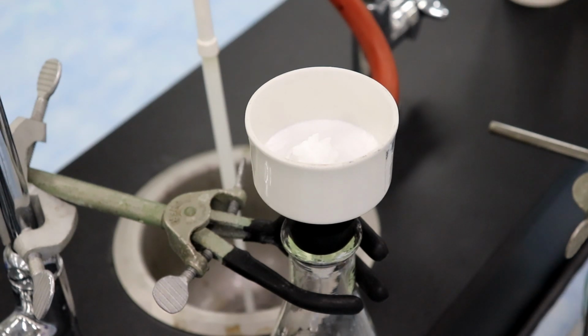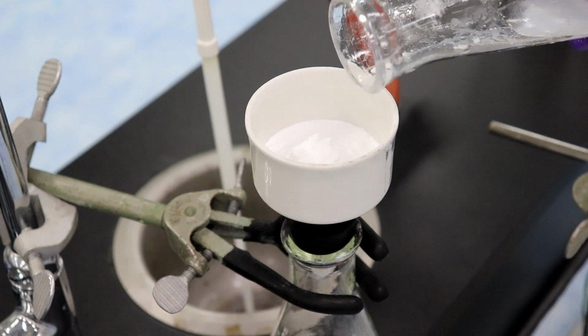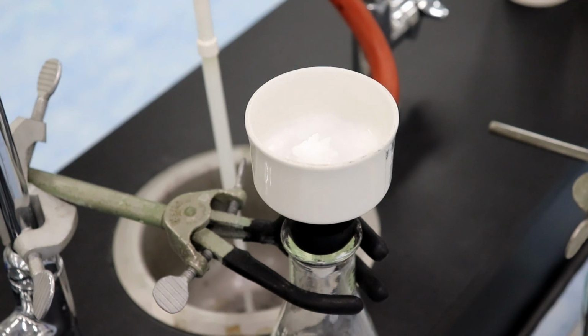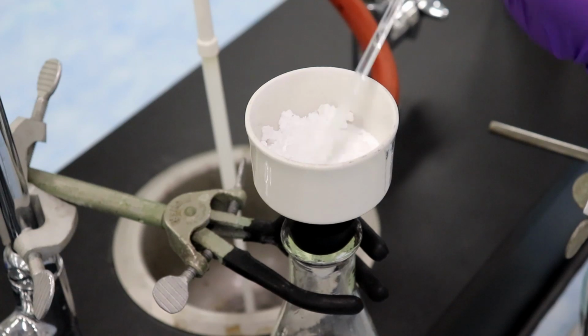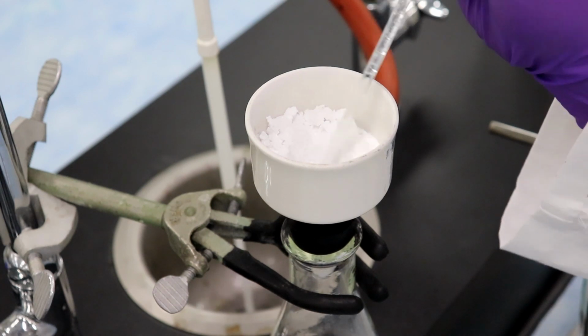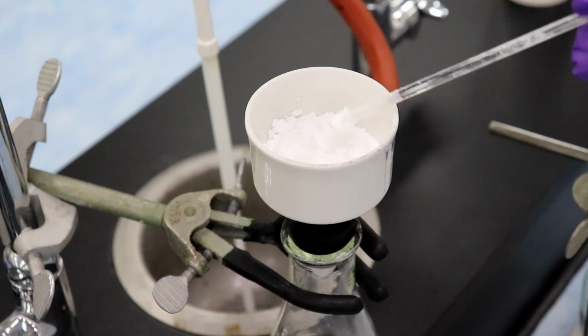And grab another 10 mils or so. We want all of it. Mix that up. Pour that through. Okay. And then what we're basically going to do now is we're going to take our glass rod that we're using. We're basically going to spread out the crystals. This is stuff that actually is in the book, but this is a great thing, again, if you want to increase your purity. You want to spread out your crystals as best you can, and then hit them with another little wash of water, making sure that you get everything possible.